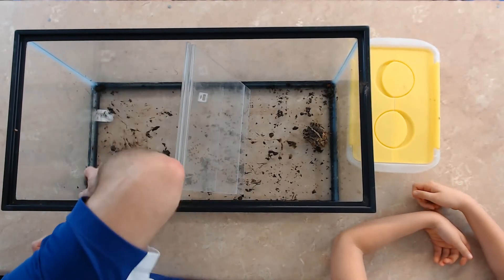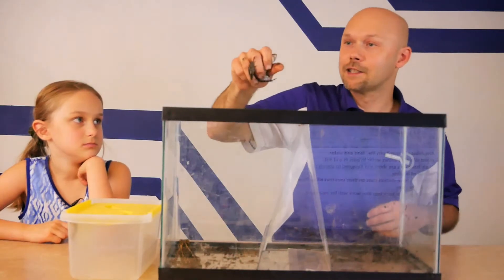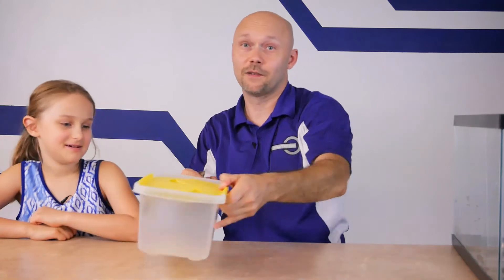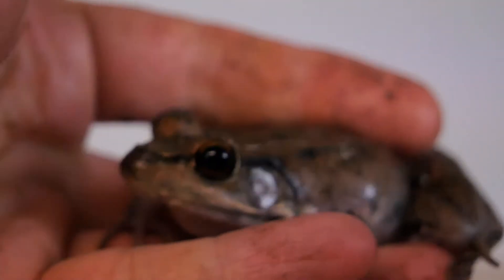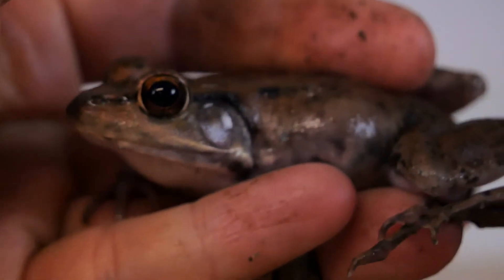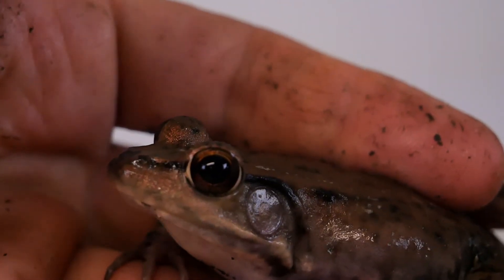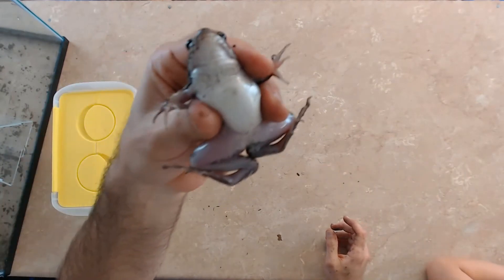This is a bullfrog and as you can see he's a little jumper. They may chirp — that doesn't mean I'm hurting them, I am barely holding them. Tren is a little nervous because this is a very fast frog. Sometimes they're green, sometimes they're brown. This is actually a pretty small bullfrog. He jumps a lot and he's very powerful and very quick.